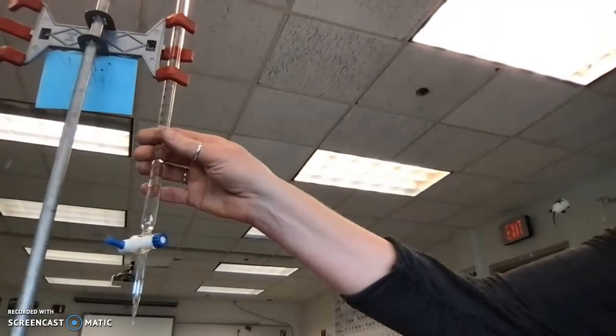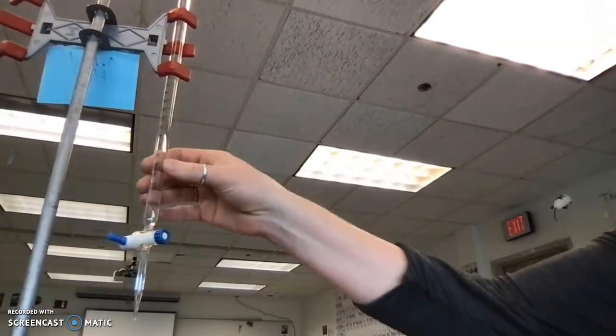Hi, this is a recording of the lab drip drop. I'm just going to show you some of what I'm doing in the procedure and also give you the data as we go. So I already used the burettes, which you can see are right here, these tall tubes. I used those and dispensed out the amount of acid.